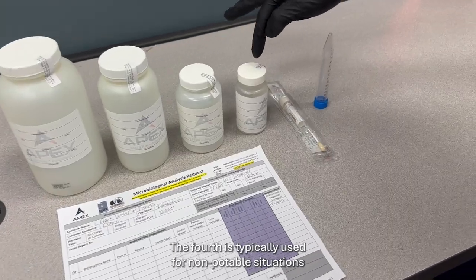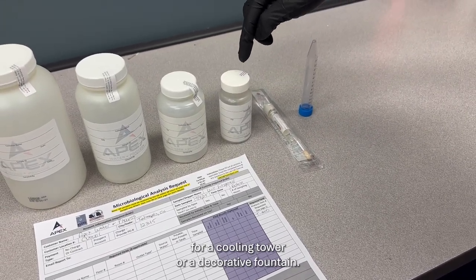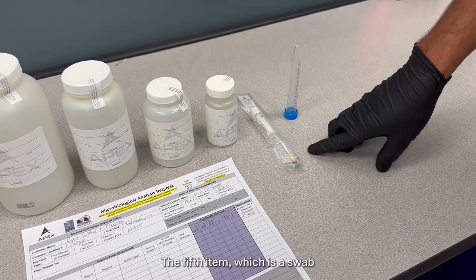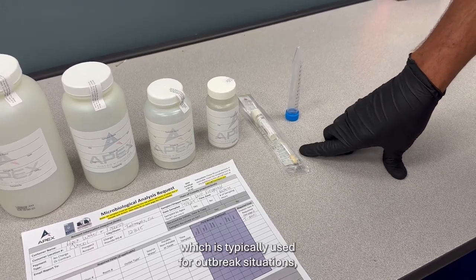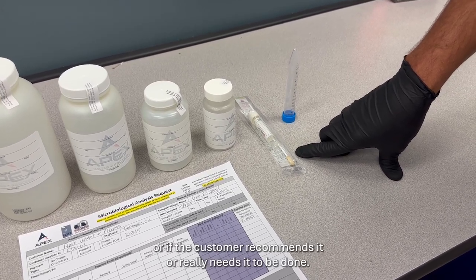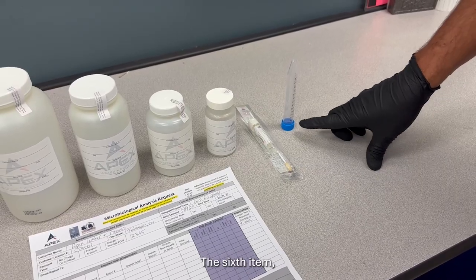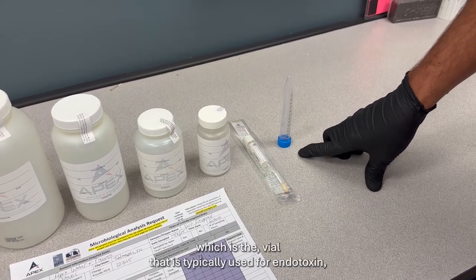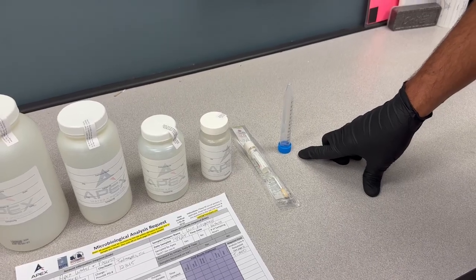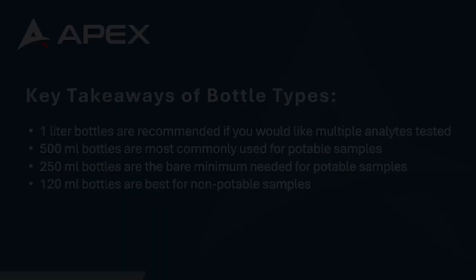The fourth is typically used for non-potable situations, like a cooling tower or a decorative fountain. The fifth item, which is a swab, is typically used for outbreak situations, or if the customer recommends it or really needs it to be done. The sixth item, which is the vial, is typically used for endotoxin, which is also listed on the back of the analysis request form.